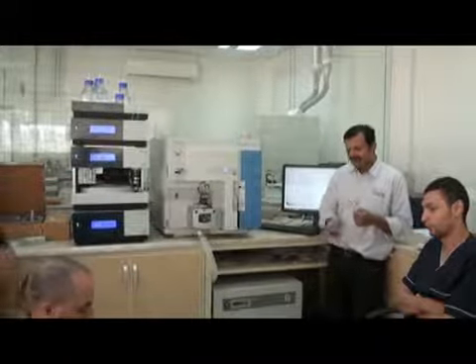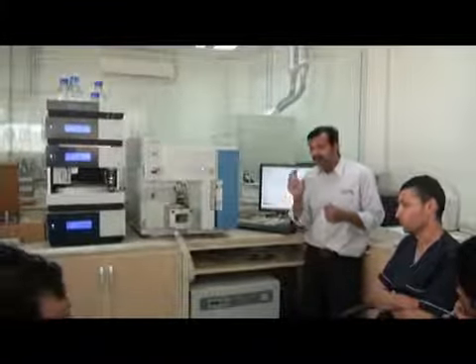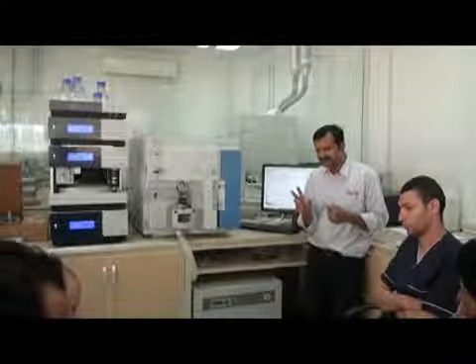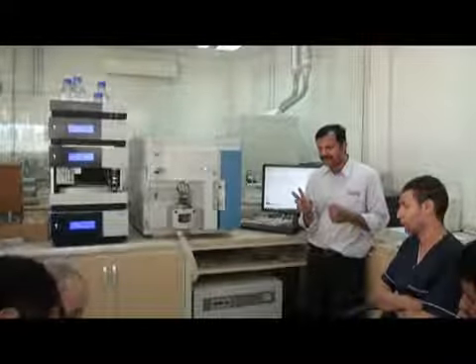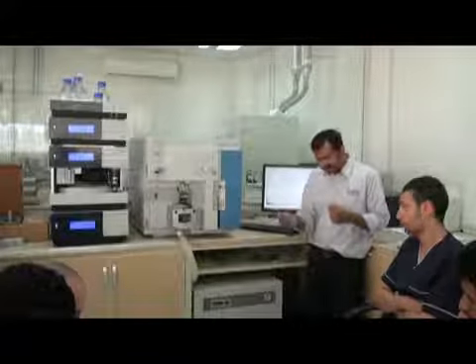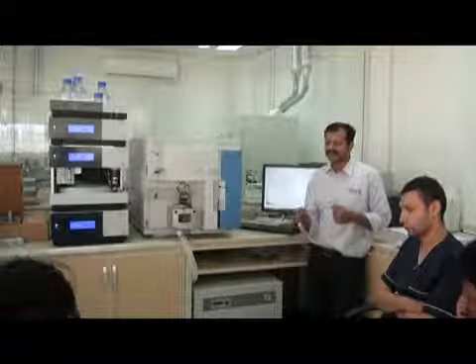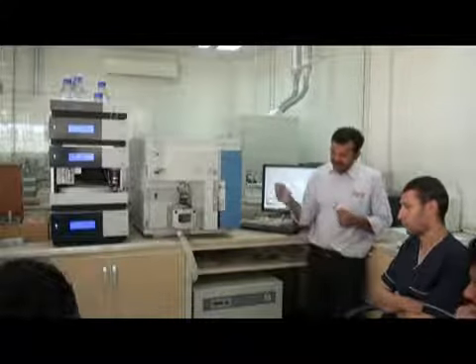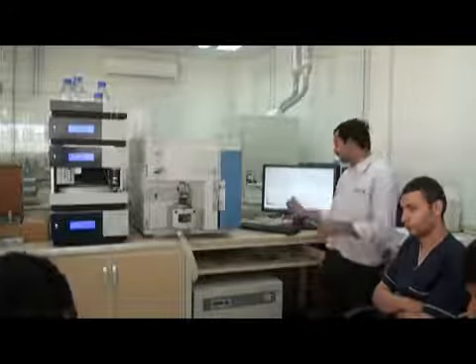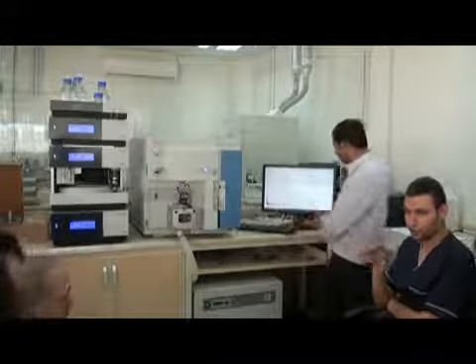Main power on. Then wait for a minimum of 1 to 2 hours. Minimum 2 hours. Then make the electronic switch on. Now understand? Now make the electronic switch on, and then it will work. Then you have to leave it overnight to get a good vacuum. This is how you switch on the instrument.